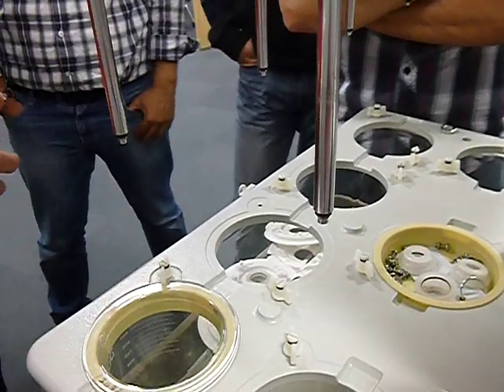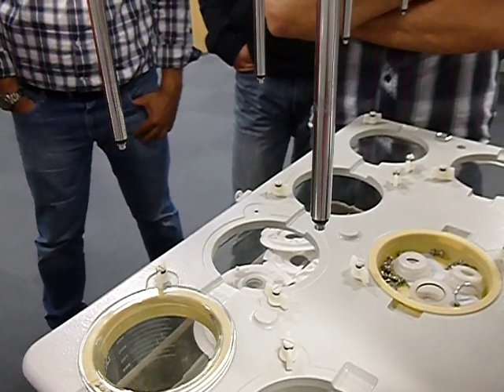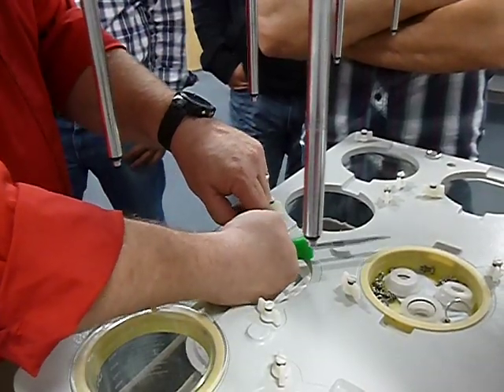Or, you know what, in worst case scenario, if you're out in the field, another thing to do is take another one of these nuts here. If you put this down through there, if it goes all the way through and it's not threading in there, you can put the nut on the bottom.